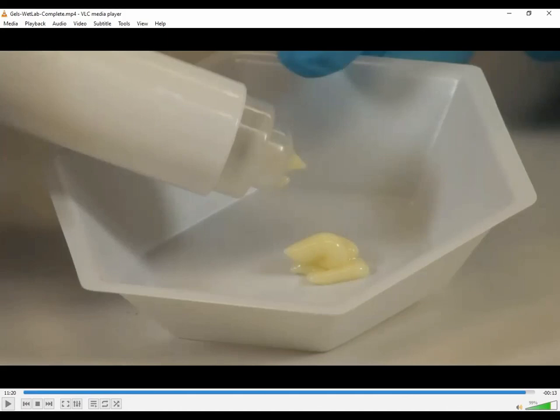A lot of times when you make PLO gels, you might just dispense it to the patient in that syringe. But the problem with that is they have to look at those little bitty markings, and to be able to give themselves exactly 0.1 mL, they have to be able to read it and push it without overdoing it. So this is a potentially much more convenient way for a patient to dose themselves. You're just going to need to put 3 squirts onto the affected area. Again, it'll be more consistent without the potential for overdose. So it's just a different way of dispensing this gel.